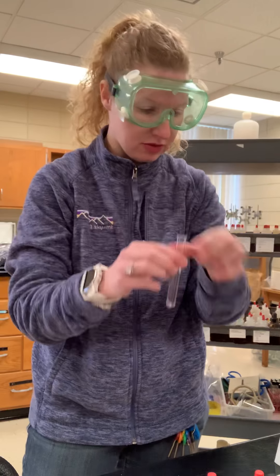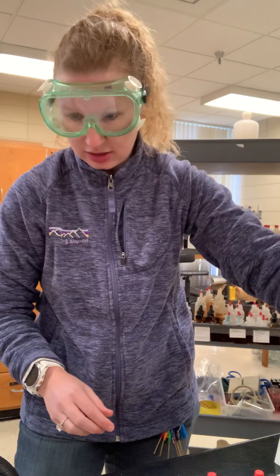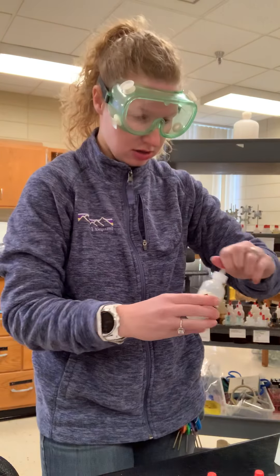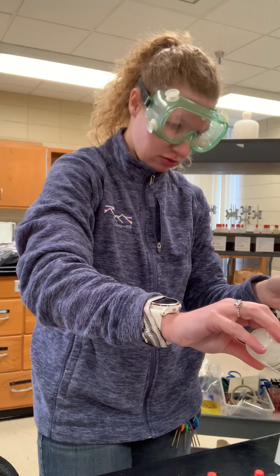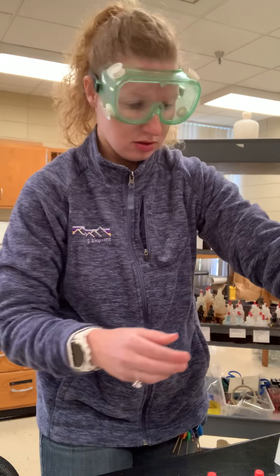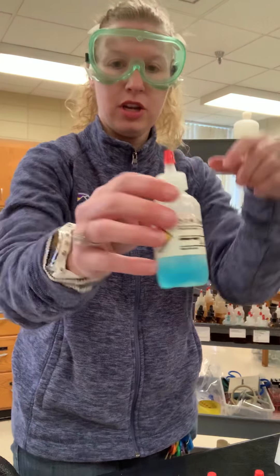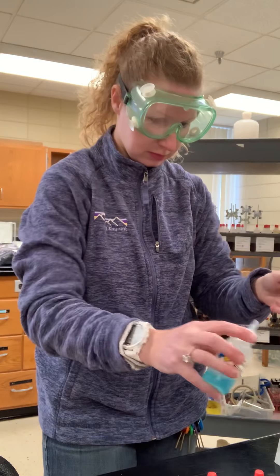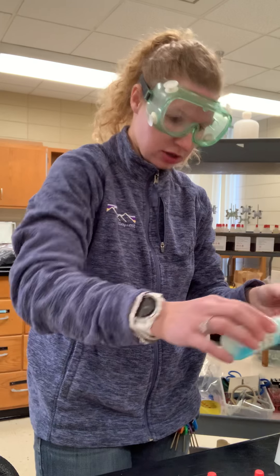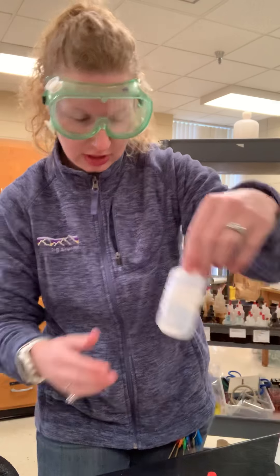Here's test tube 1 — I have 3 drops of silver nitrate. Next, mercury nitrate — one, two, three. Then copper nitrate — one, two, three. And zinc nitrate.